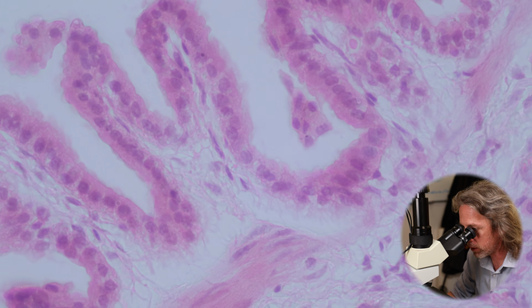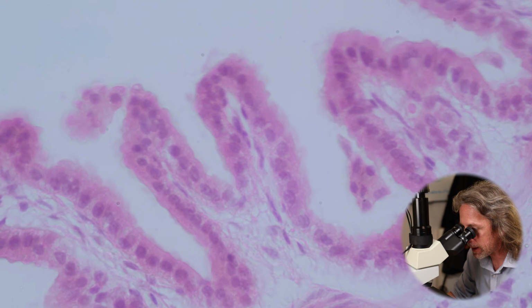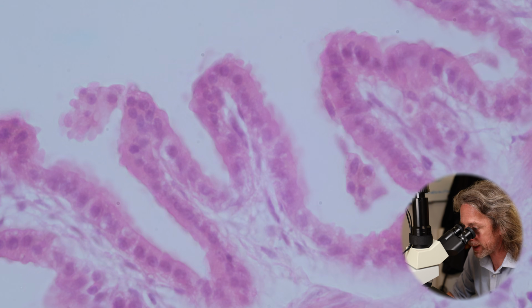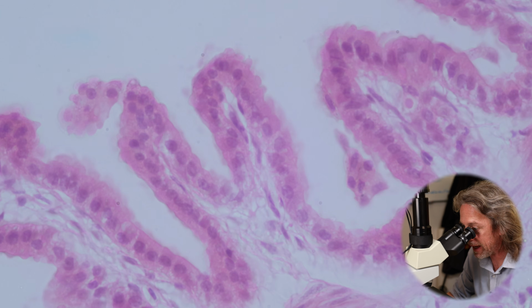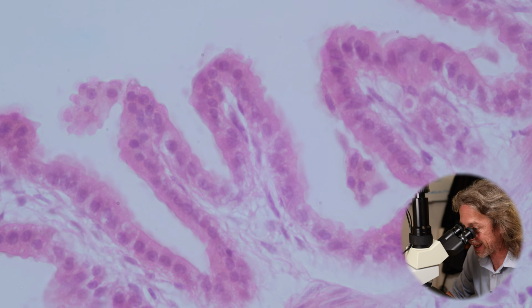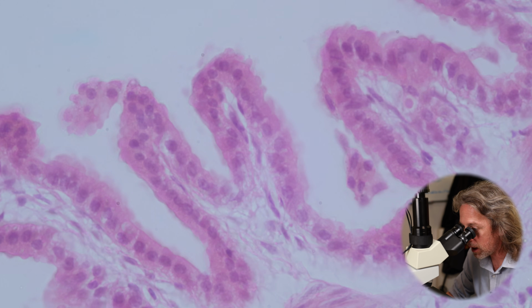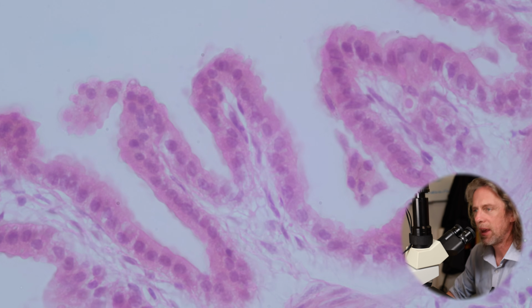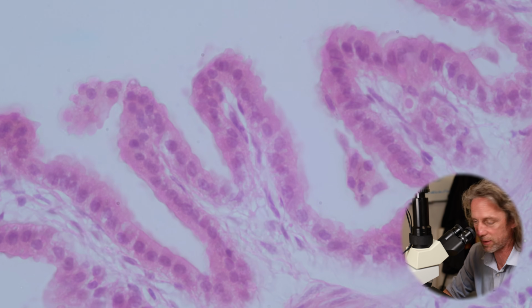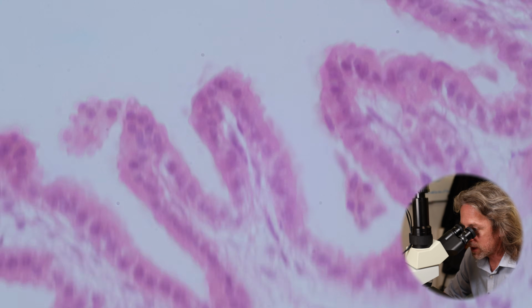So these cells are worth mentioning because they have a number of jobs. They are a progenitor cell helping replace lost epithelial cells. They clean up toxins. They manage a lot of toxins and harmful things that get down into the airway. And they produce proteins that interact with the pulmonary surfactant and things like that. So the club cells are an important cell type in the airway, which might be mentioned, but are quite difficult to identify with a normal stain.